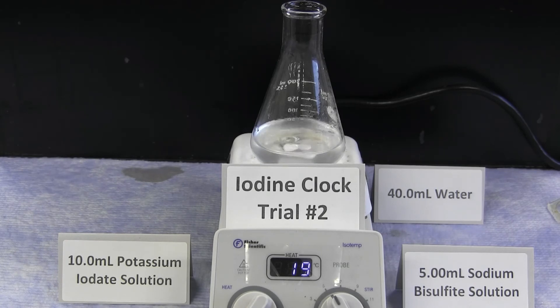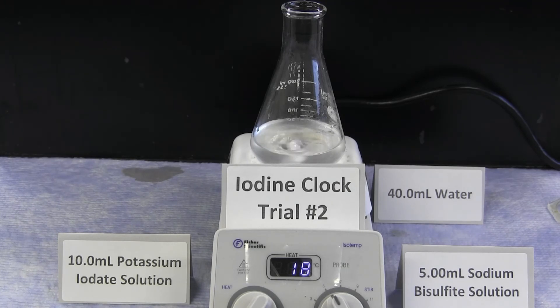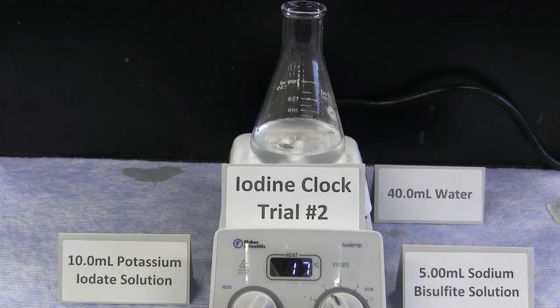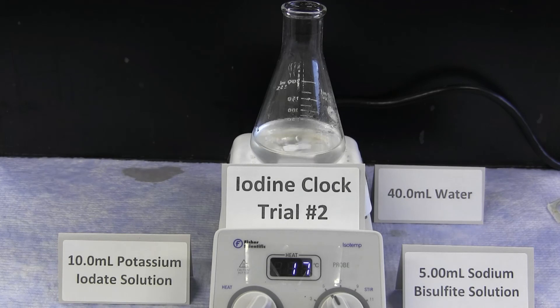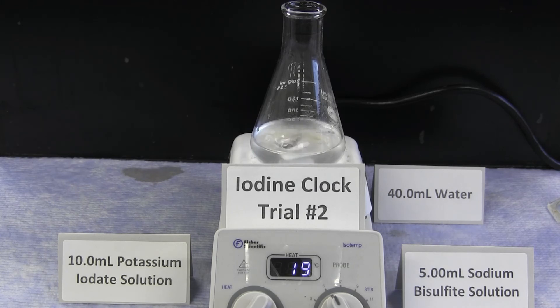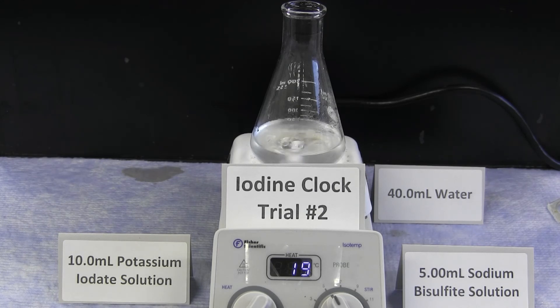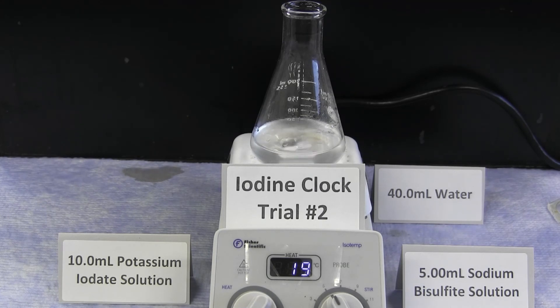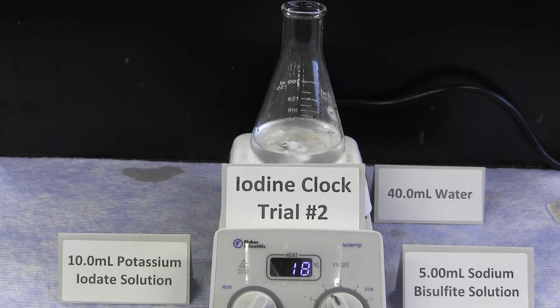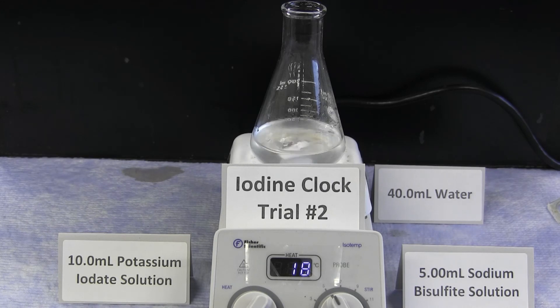This change in concentration is changing the reaction time. If you were to plot the negative log of the reaction time on the y-axis versus the log of the concentration of potassium iodate, the slope of that straight line will equal the reaction order for potassium iodate. This reaction can also be performed by varying the concentration of the sodium bisulfite ion, thereby determining the reaction order of sodium bisulfite. In the rate law, the reaction order can be different for the two or more starting reactants.